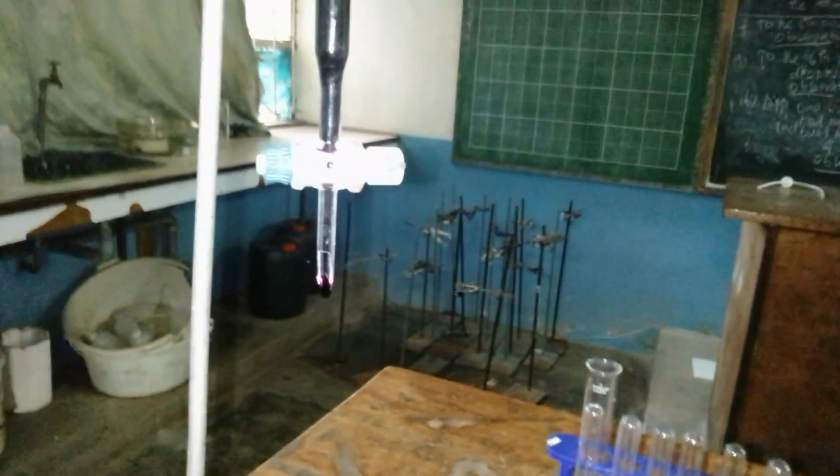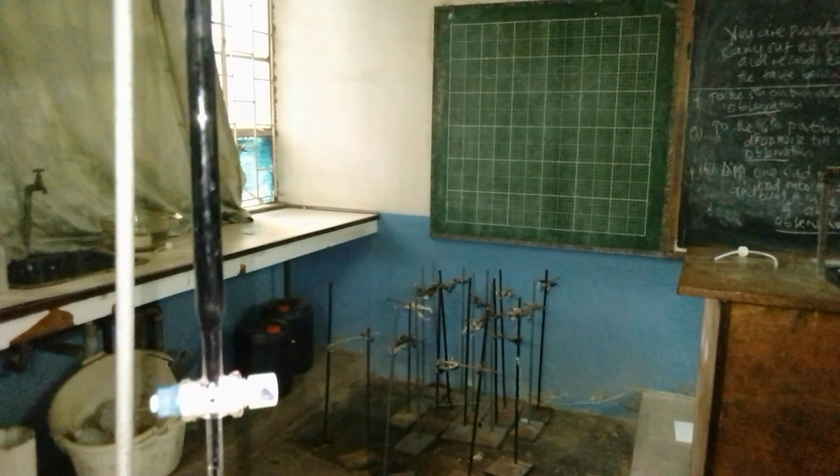They were also using this measuring cylinder to measure 1 molar sulfuric acid for acidification of the iron 2 salt, and also the potassium permanganate that was supposed to be acidified. And as you can see, this is just a redox titration, because we don't have any indicator that was being used here for titration. We don't have any indicator. So these solutions are their own indicators, and that's why they are supposed to be acidified.